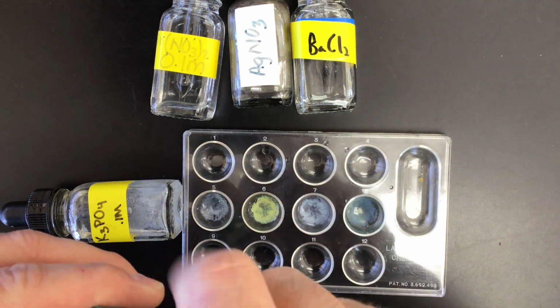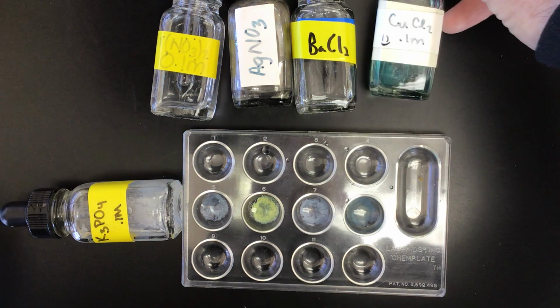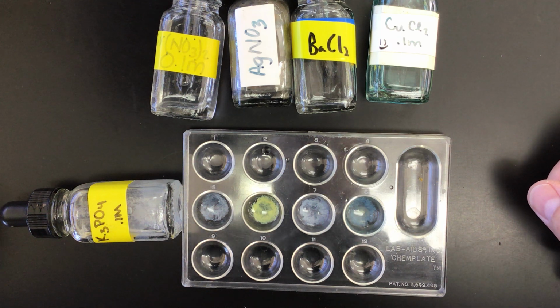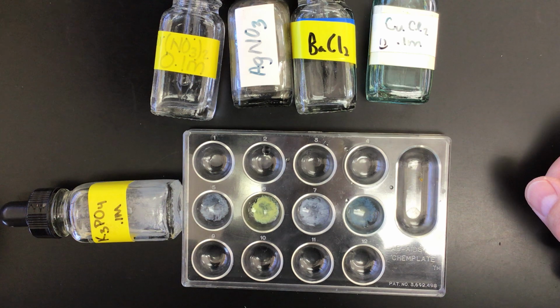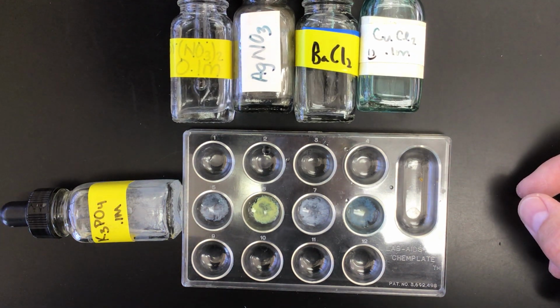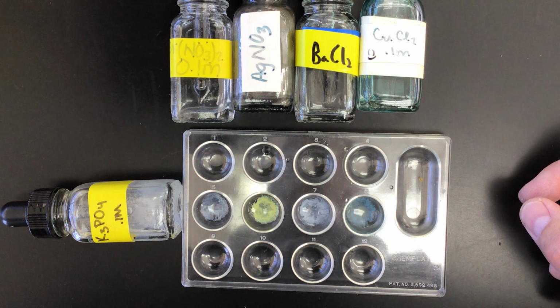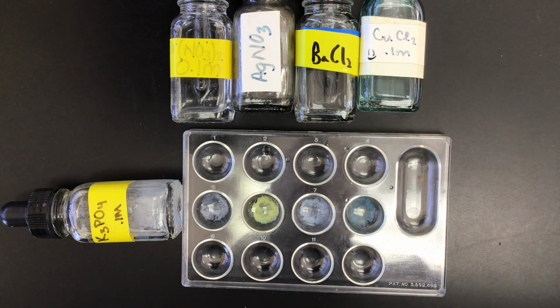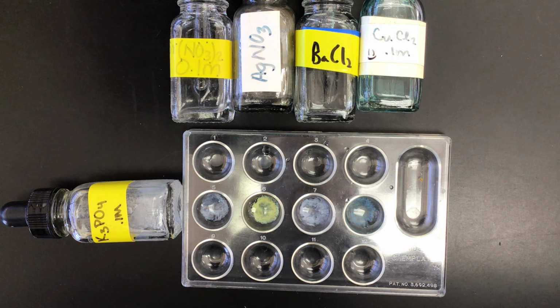Now, if a precipitate is going to form, generally it's going to happen pretty quickly. And if I block some of the light coming in, you can definitely see precipitate forms in each case. If you're doing a more complicated lab like this, you can use the color of the precipitate to help identify what the precipitate is. But for this particular lab, all we're looking for is when we make a prediction using our table of solubility, does that match what we actually see in lab?